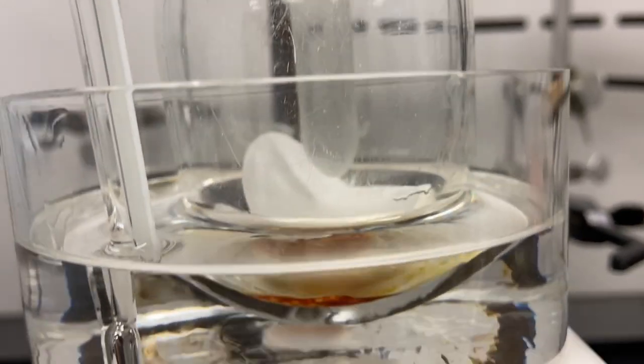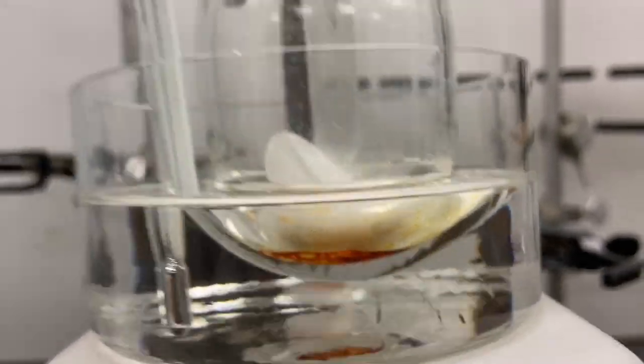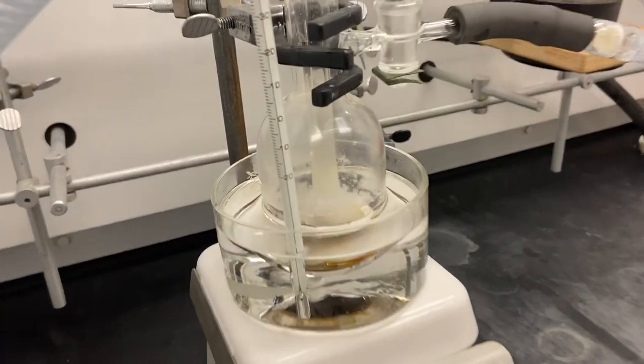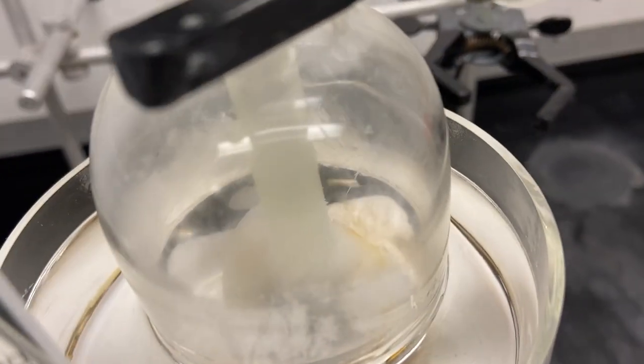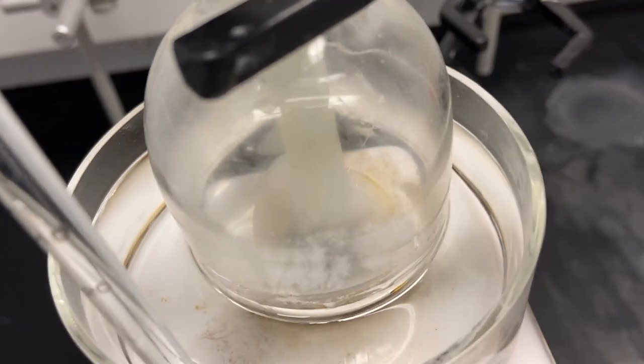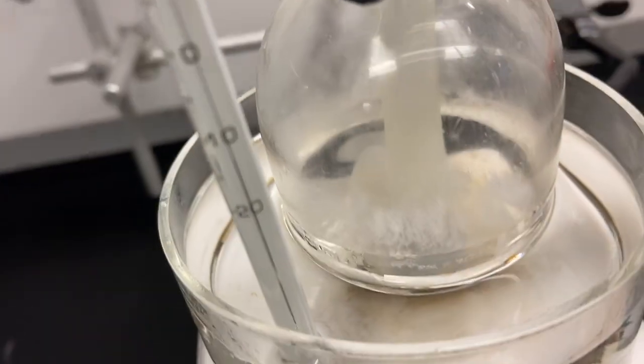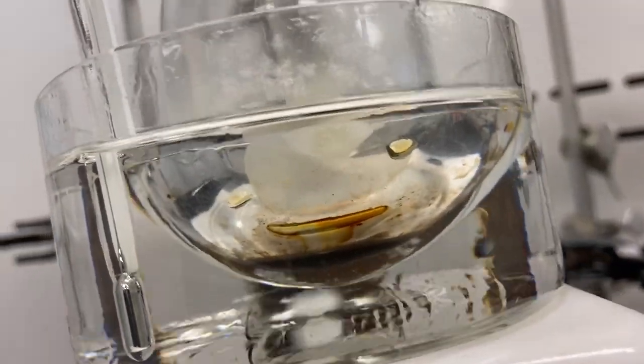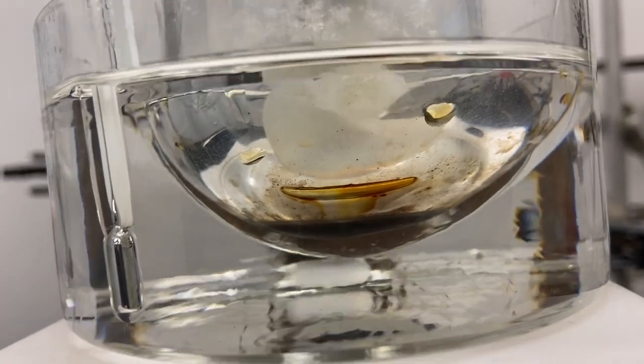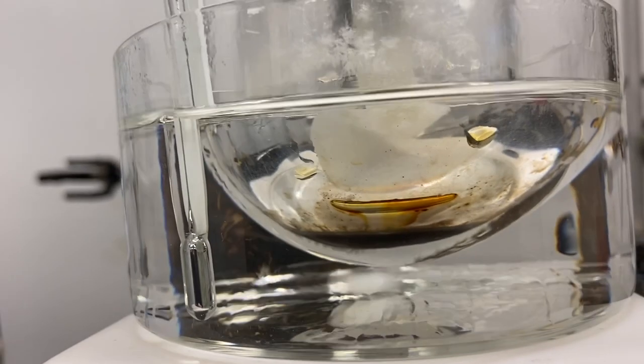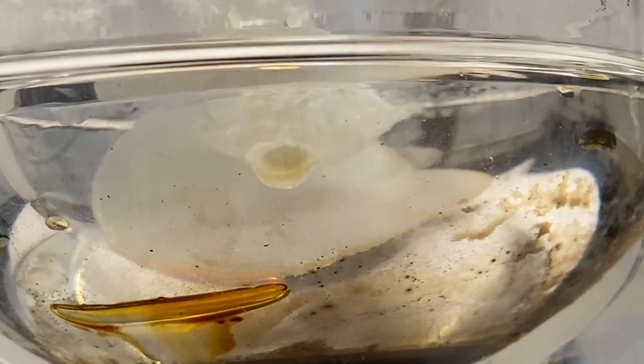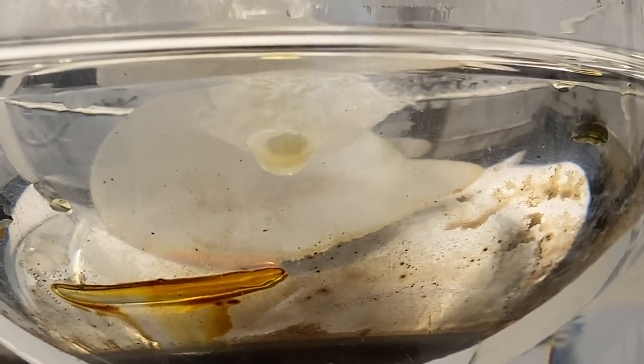Welcome back again, we're almost done here. I had to increase the temperature to about 150 degrees. The bubbles that we saw earlier must have been trapped solvent. We can see some of the crystals have grown on the wall of the flask, but most of it has sublimed in the middle. The cool finger has a thick crust of crystals sublimed to it. I will run it a few more hours to get the last bit.